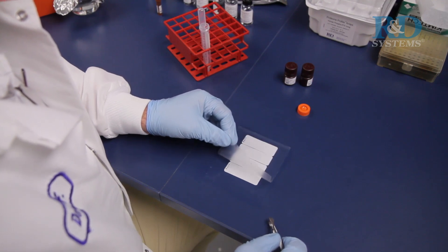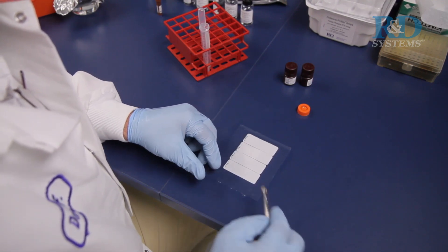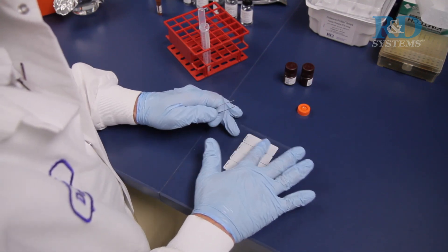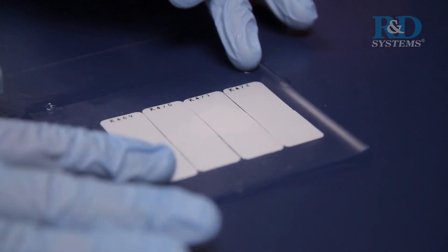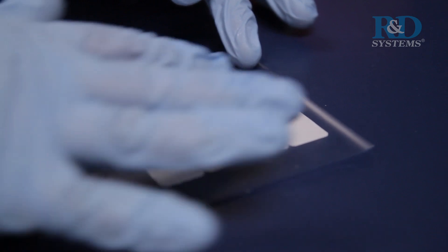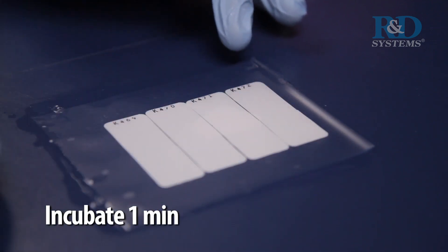Carefully cover the membranes with a plastic sheet protector. Gently smooth out any air bubbles. It is critical that the chemireagent mix is spread evenly to all corners of each membrane. Incubate for 1 minute.